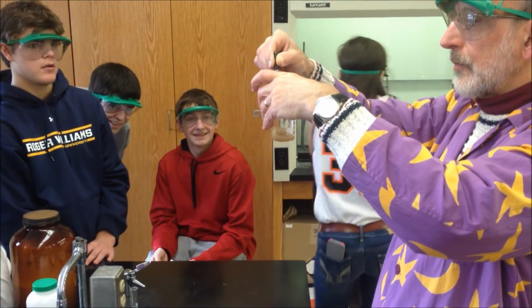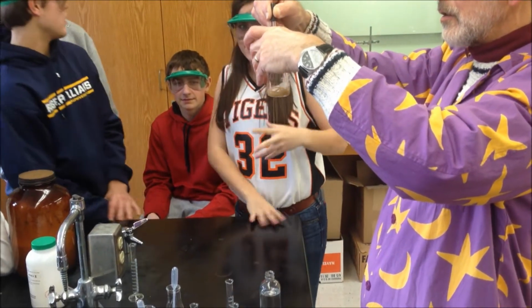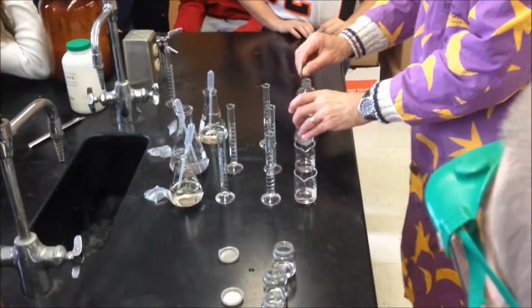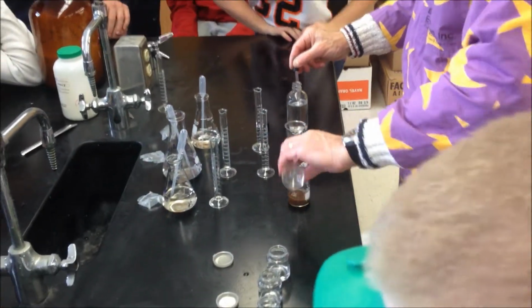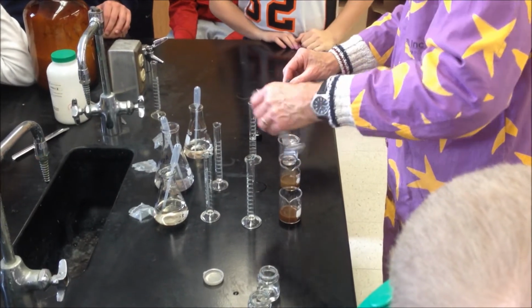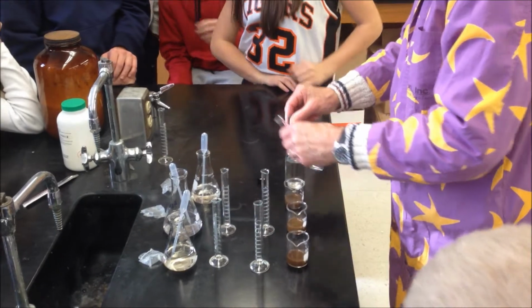Oh my God, I smell it. I know, this is the strong ammonia. So strong. I don't smell nothing. Yeah, I think it's the fans blowing. Oh no, it smells like hair dye. Breathe through your mouth. So brown. Looks like coffee. There it is. It just hits you. It's like bam.